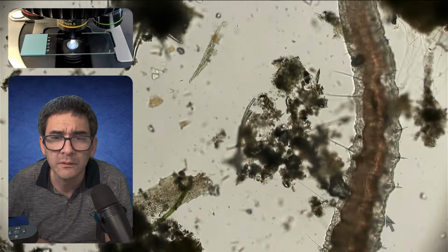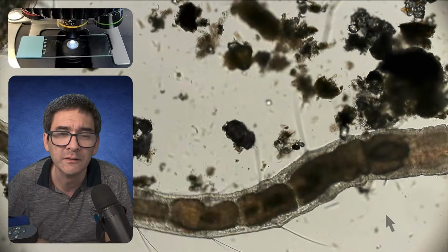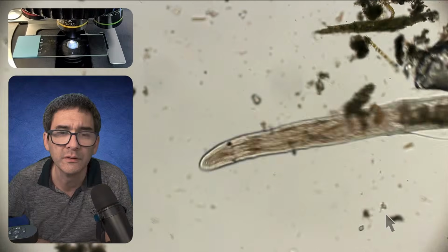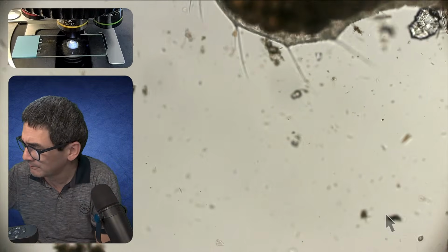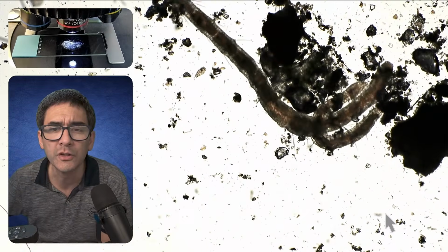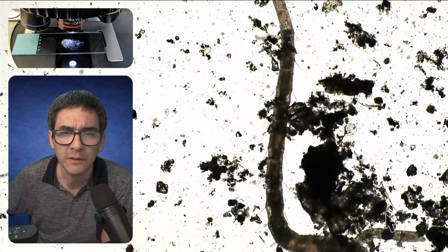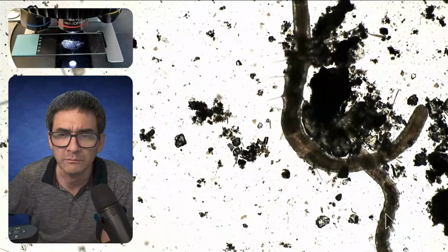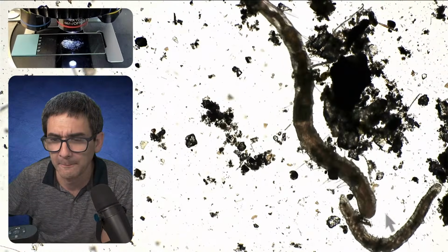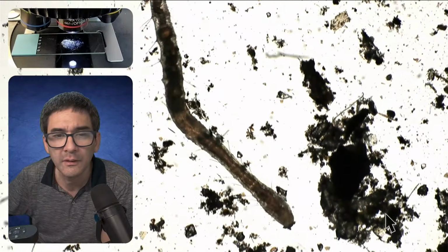Ah, yes, that's a worm. Okay, this is a pretty huge one. How many worms are there? Yeah, that's a worm. Okay. Actually, there are two worms here. Yep. Okay. Yeah. So over here we definitely see those bristles. Yeah. So quite interesting here.